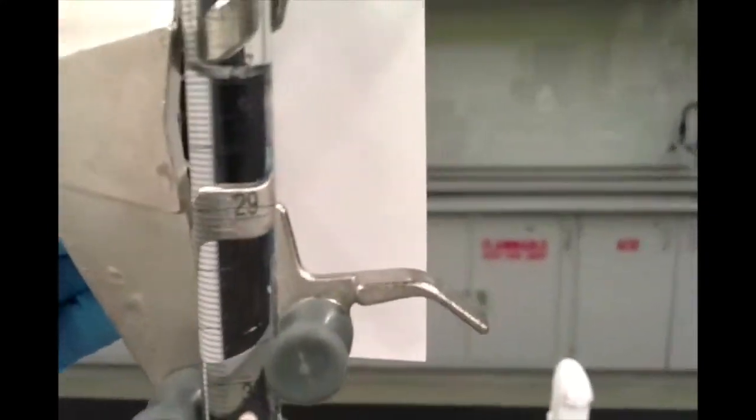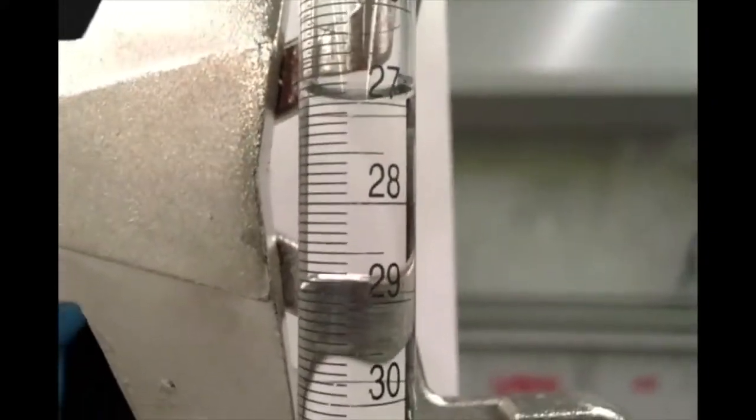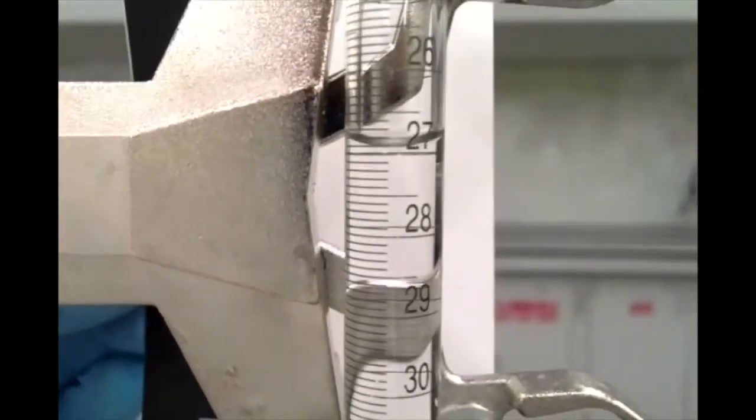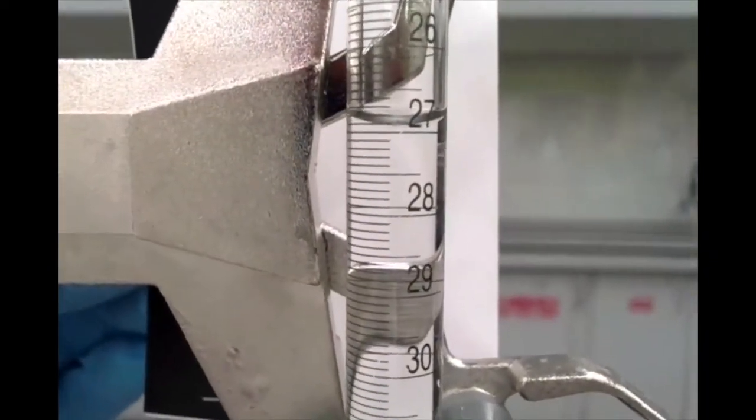So again, if you want to make a note of that initial volume now, okay, that initial volume is, let's see, I'll try and get a, yeah, sorry, I'm trying to organize this here. So basically, hopefully you should see that, and I'll try to get that avoiding parallax error. And of course, I'll include a picture from my phone that might make that a little bit easier to read.